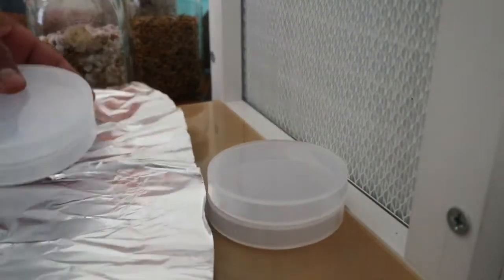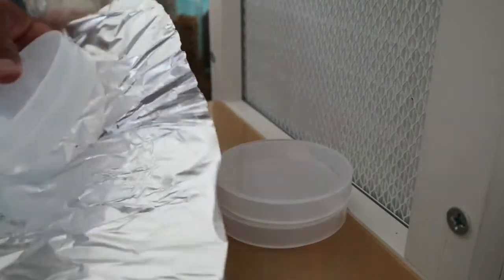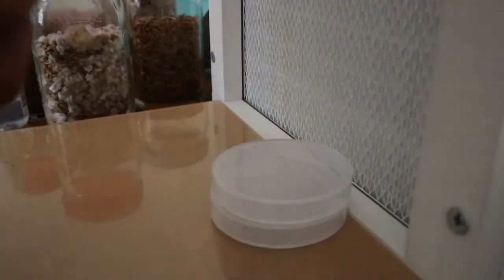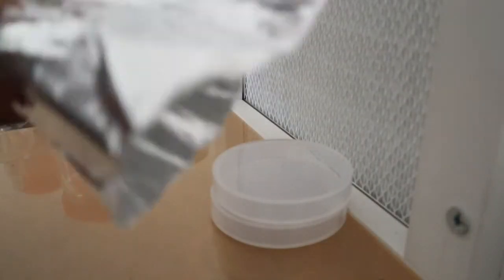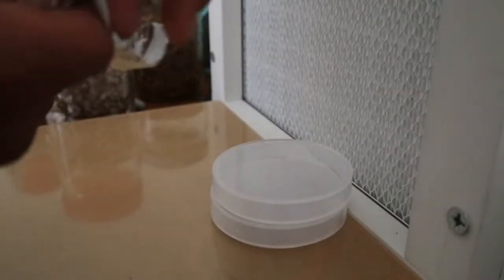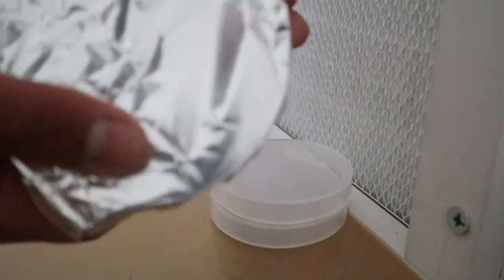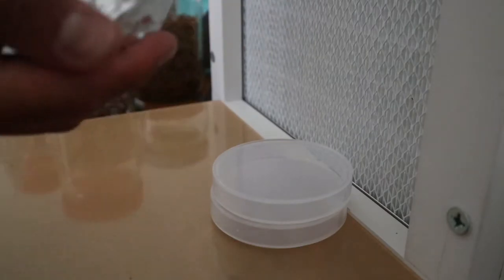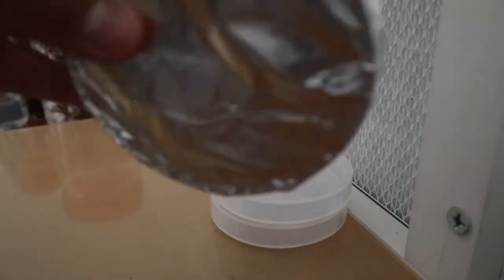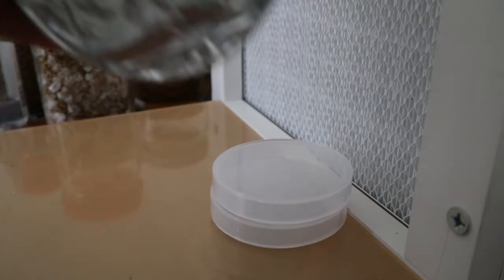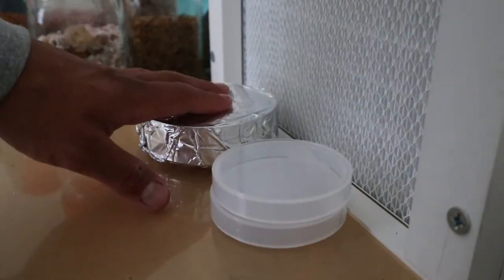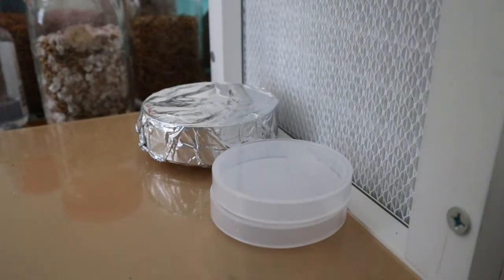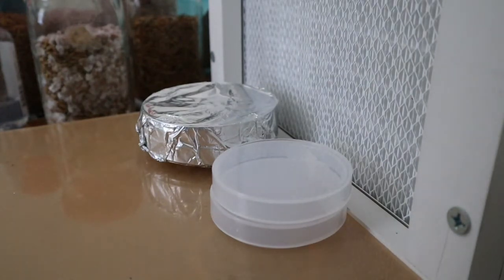Now what I do, I put it in here like that, and then I just fold it over like that, fold it off. It's kind of hard to see the angle of it, but you want something like this to prevent the moisture from getting in the plates while you're pressure sterilizing them. So you wrap them up like that in tin foil, toss them in the pressure cooker for like 30 minutes when you cook it with your agar.